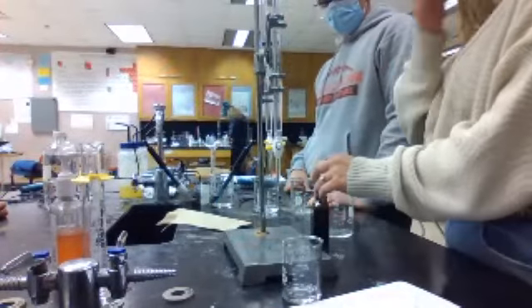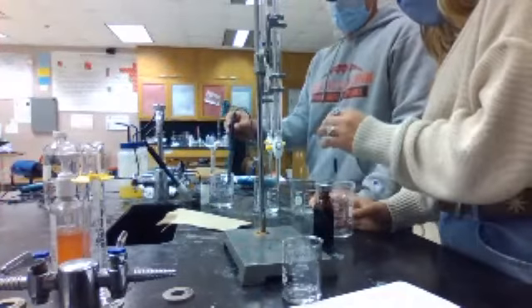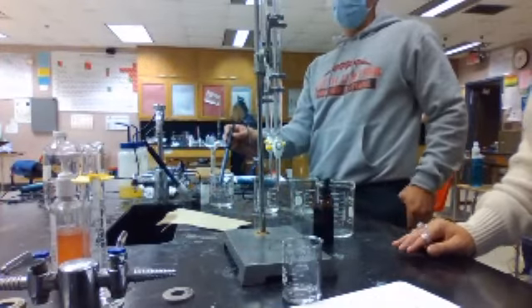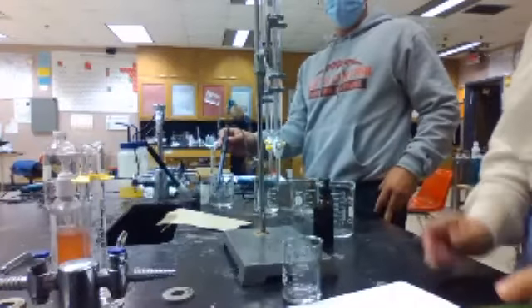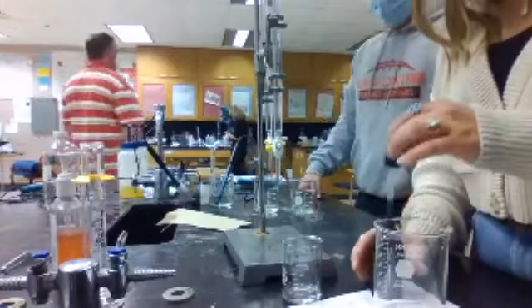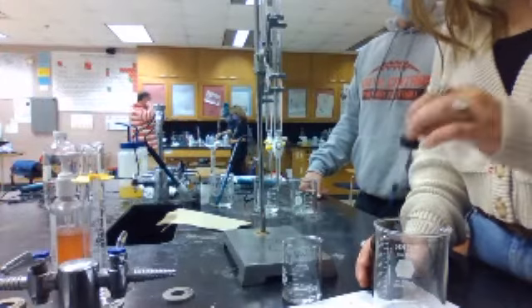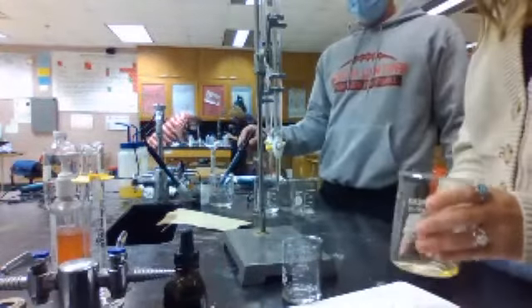Well, how much time do we have? Just try to get it done. I'm around 12:41. You've got 11 minutes. Maybe we should only do it for trial 3 then. Okay, that works. If you haven't started the pH one yet, you may not want to. You may save that for tomorrow right when you come in.